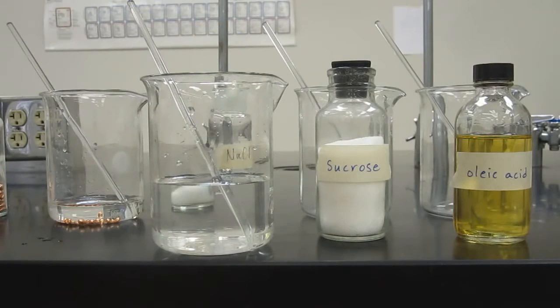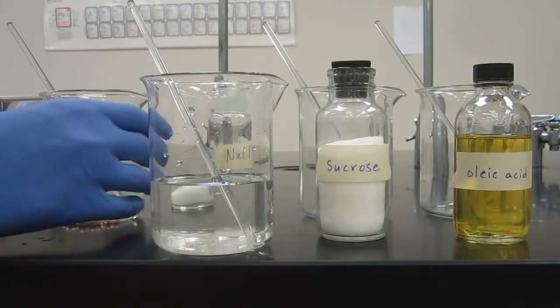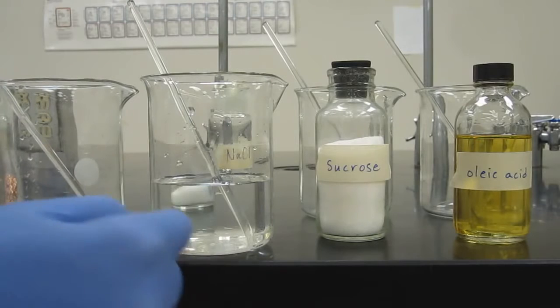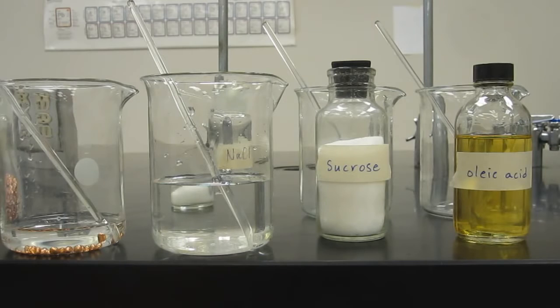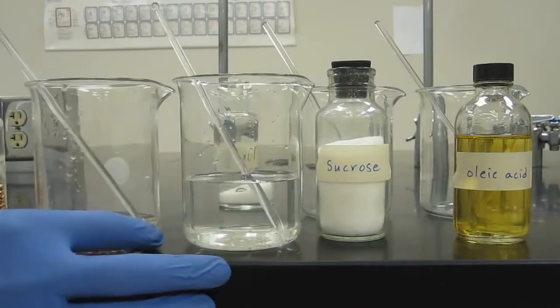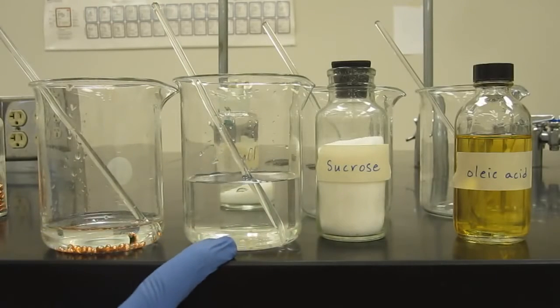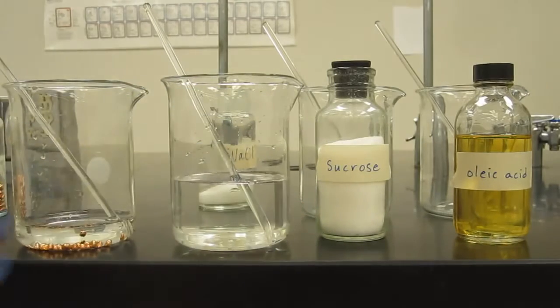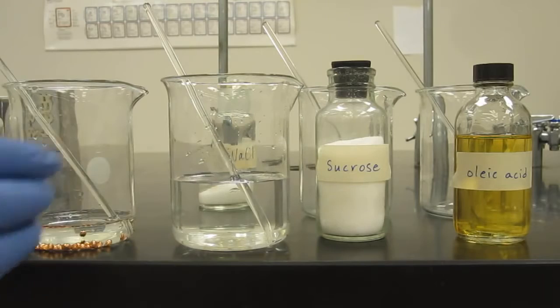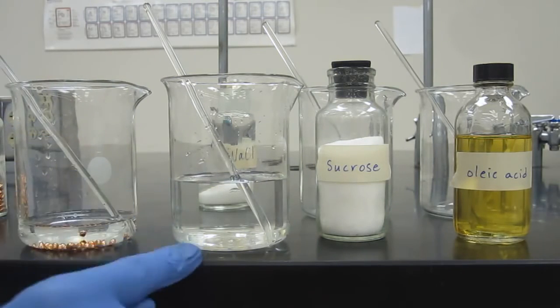So mixtures have the properties of both of the components of that mixture. This is different than the copper mixture, because you can't see the sodium chloride particles anymore, but you know they're in there because their properties are still being shown. You can still see the copper particles here. This we call a solution, or a homogeneous mixture. In chemistry we call homogeneous mixtures solutions. So: heterogeneous mixture, homogeneous mixture.